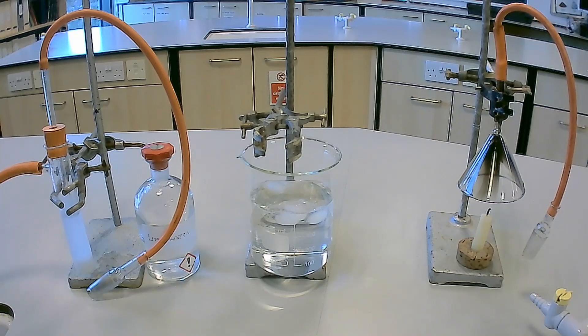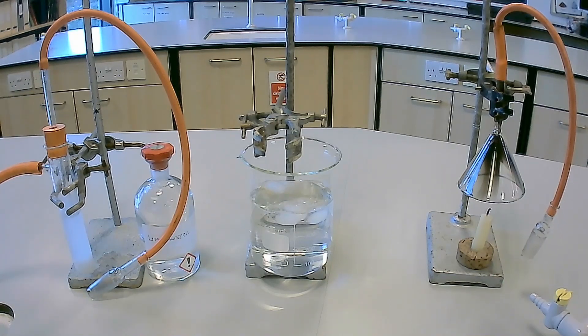This is caused by the hydrogen atoms present in the candle reacting with oxygen from the air and forming water vapor, which are then drawn through the apparatus. The equation for the formation of water during combustion is shown on screen now.